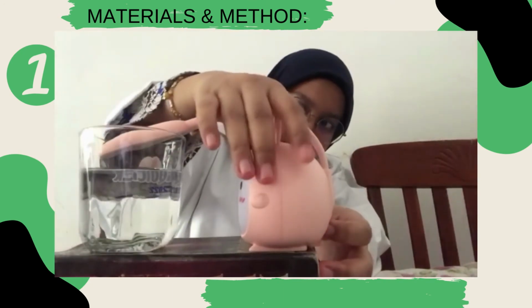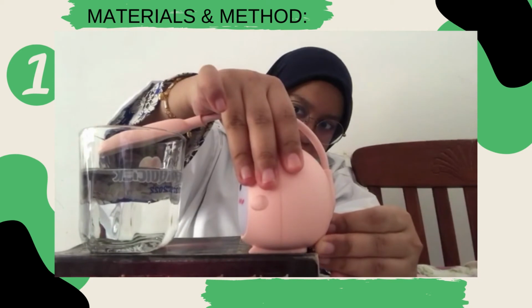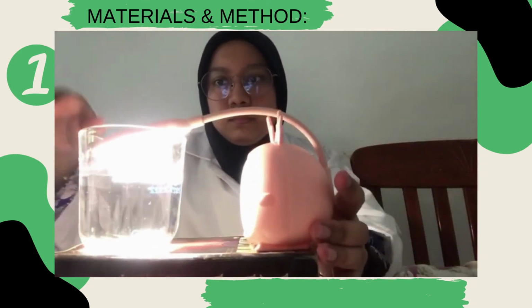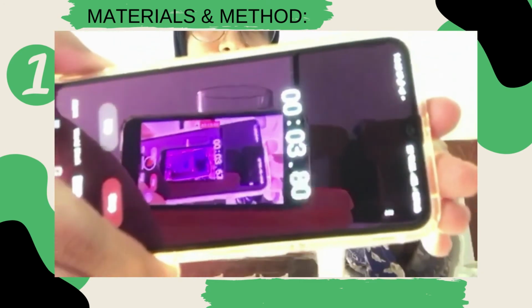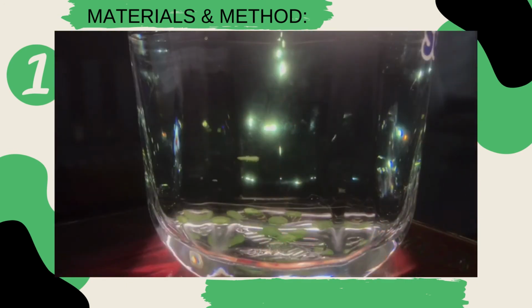Once finished, remove the light and put the cup in the dark for 15 minutes or cover it with aluminium foil. But I'm using a box to cover the leaf. After that, repeat steps 3 to 15 using the same leaves, but this time set up the table lamp so that it is suspended about 10 cm above the beaker. That's all.